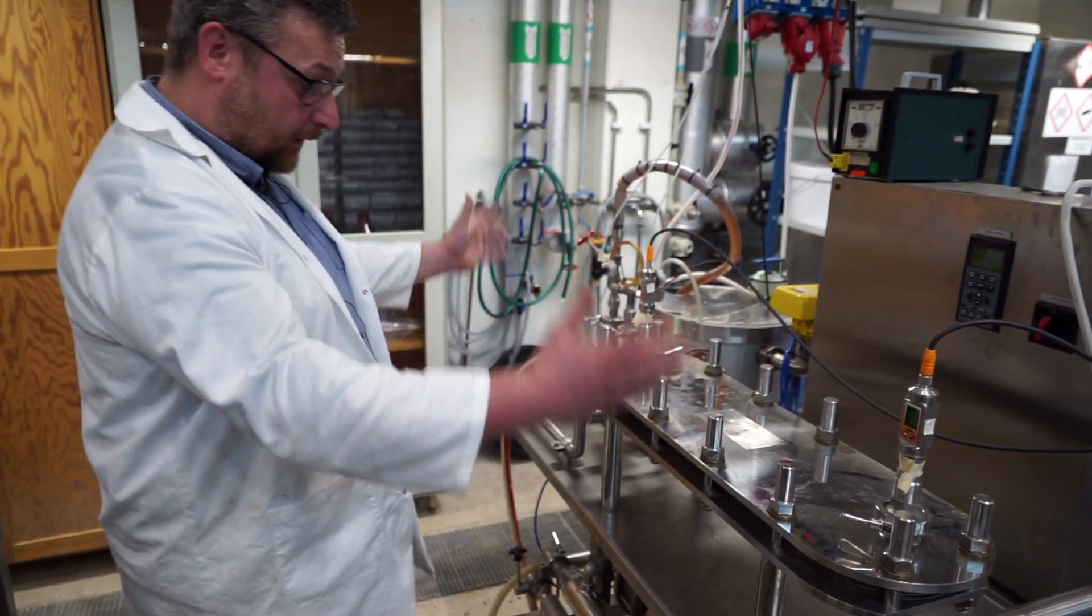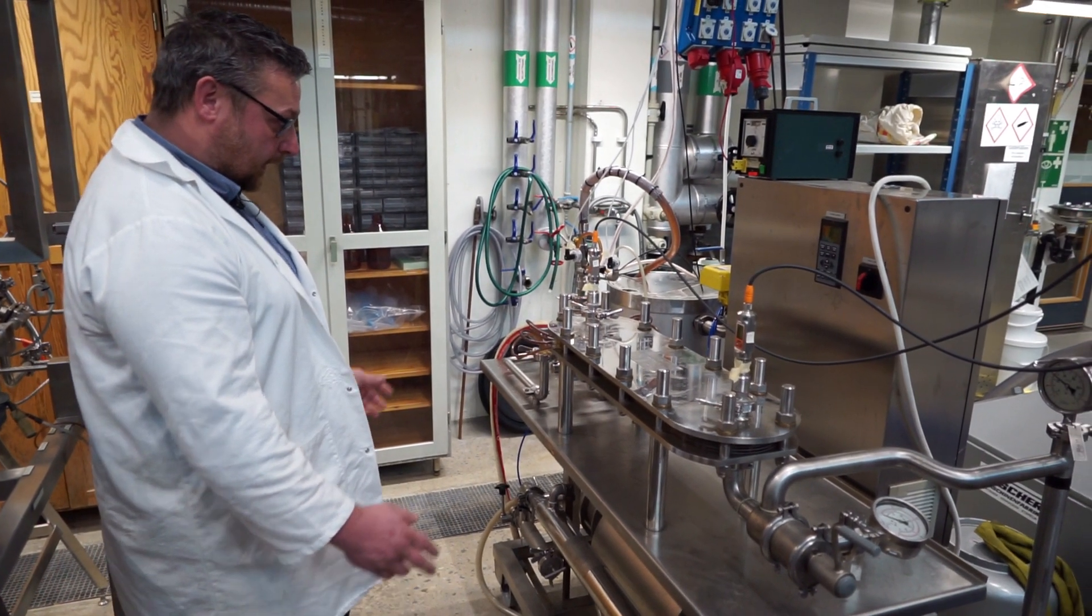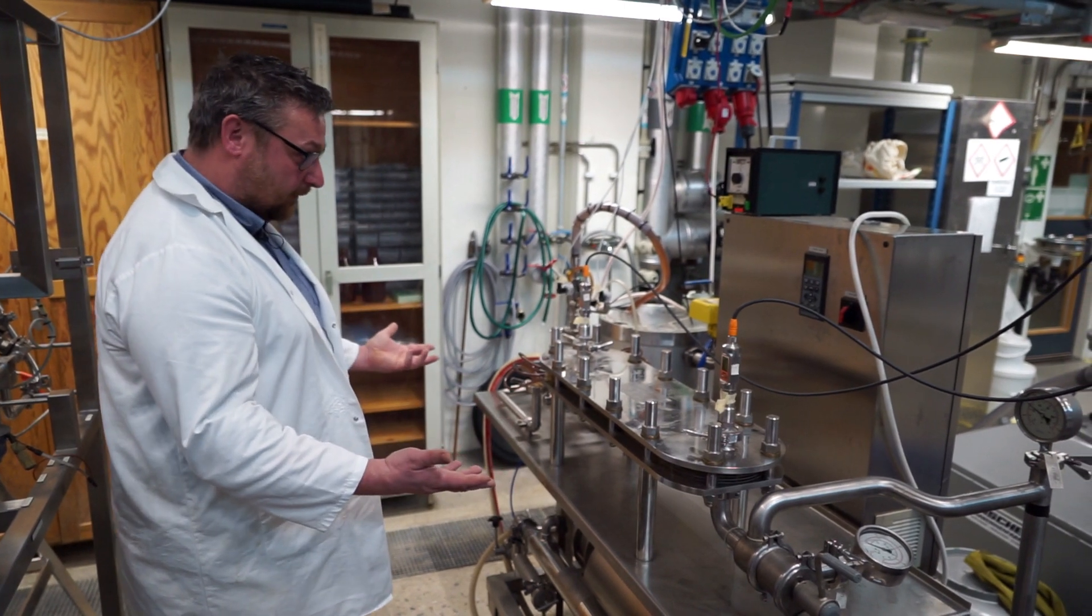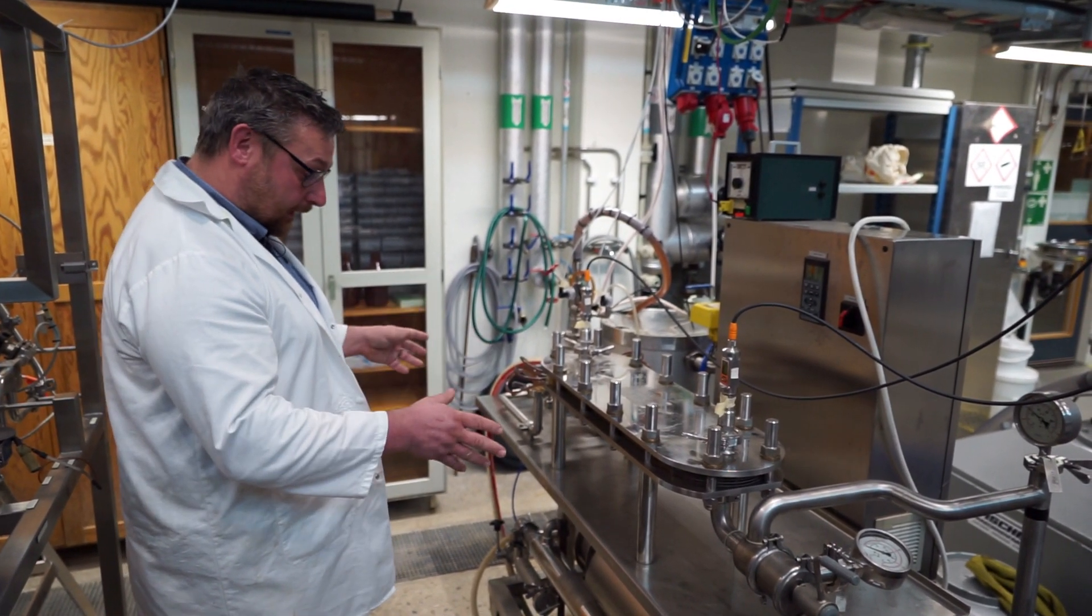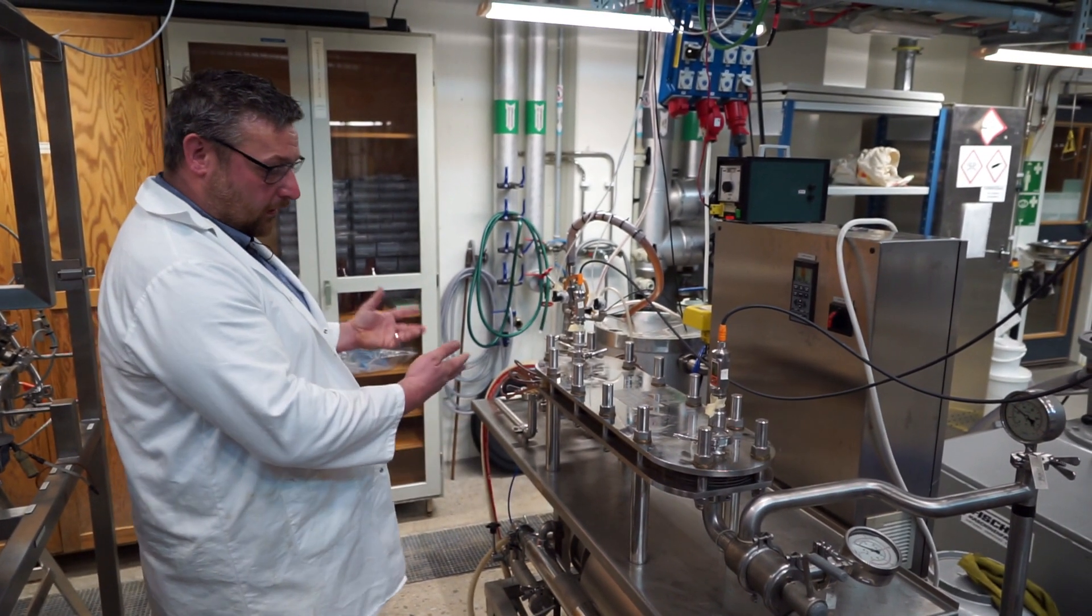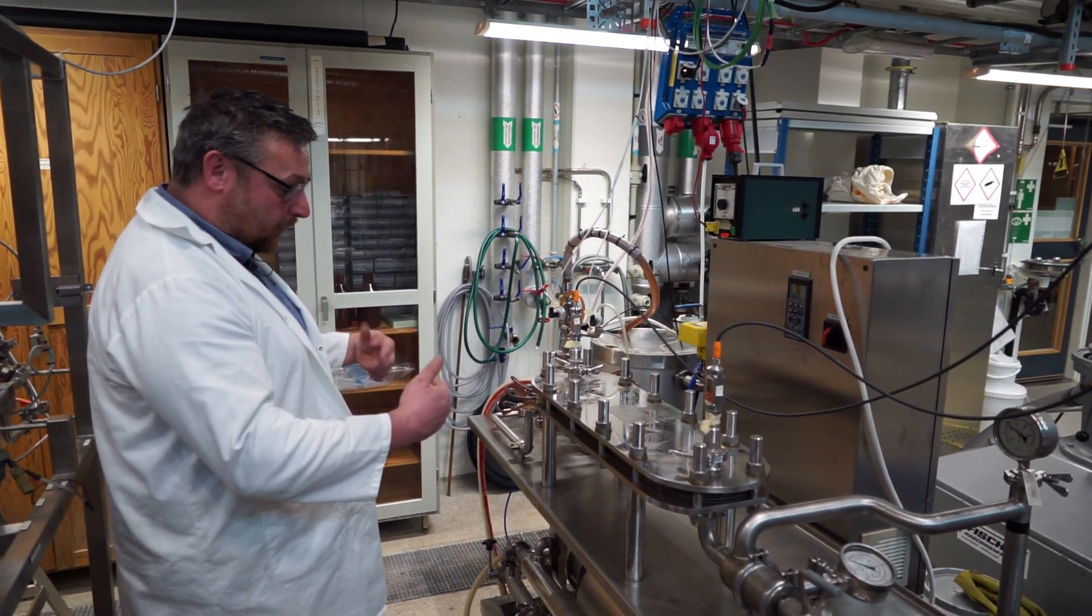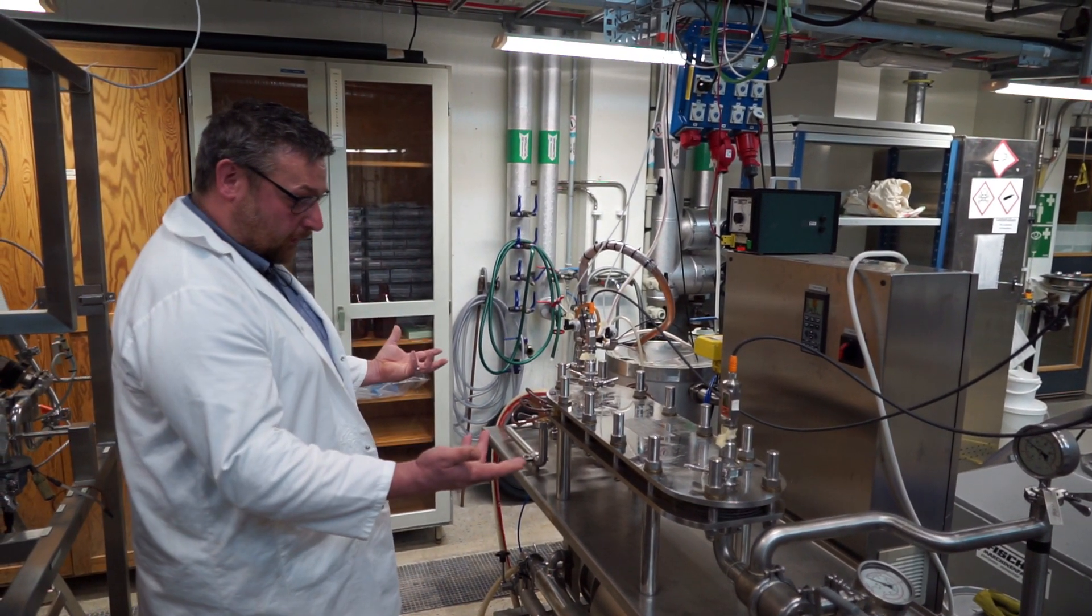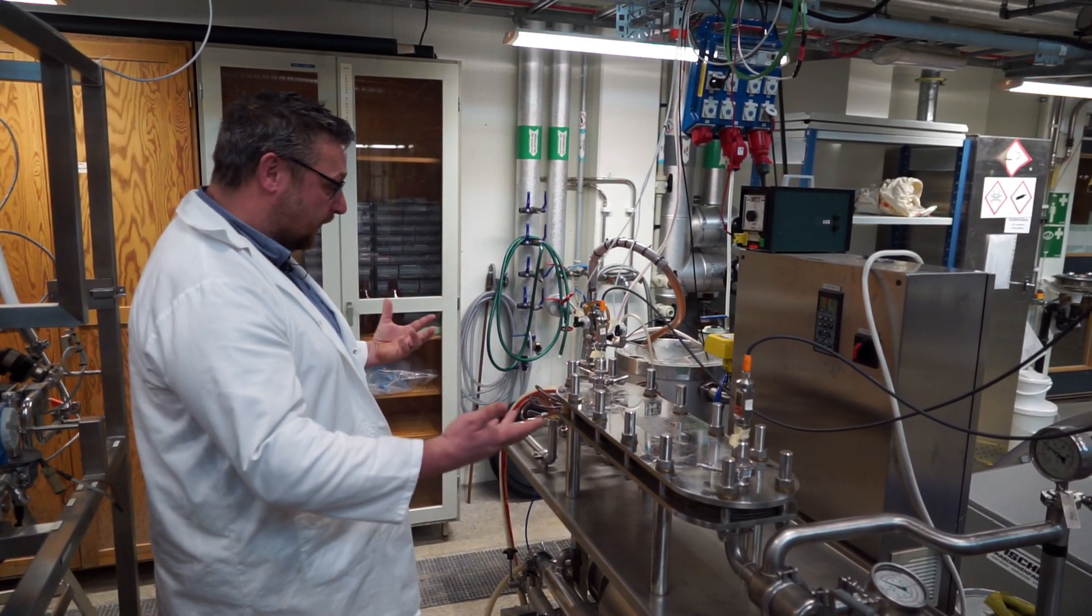So this is the solution, this is the membrane module. And this is only one part of the actual system. The task in this demonstration is to make a flow chart of a typical membrane module. And I will also start this one up to show you how they operate and what you will be able to see.